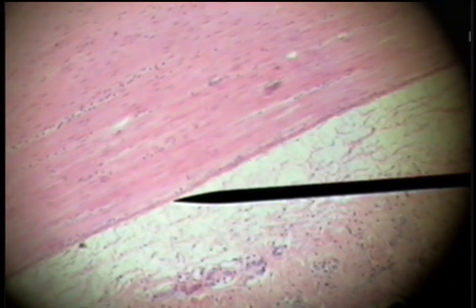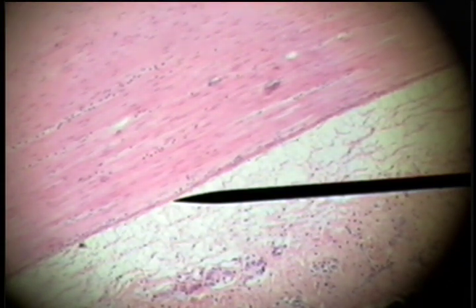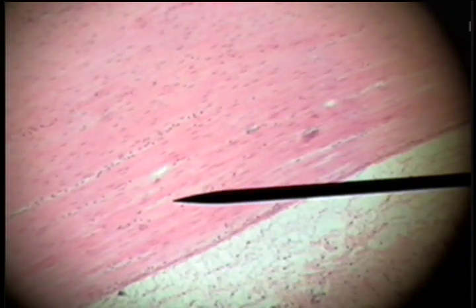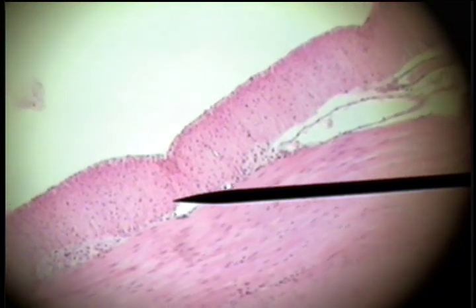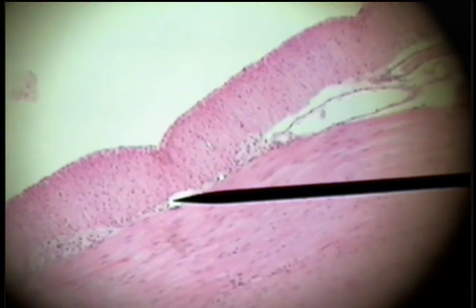Here's the wall beginning here. This is the inner wall. This is a longitudinal section of smooth muscle, and as we reach the outer edge, this is a cross section here.